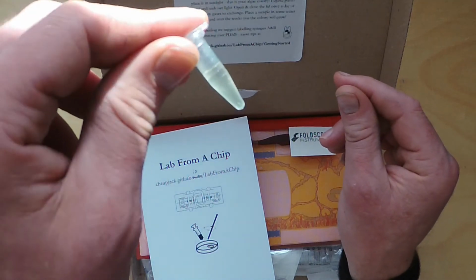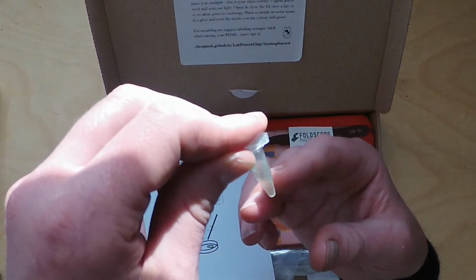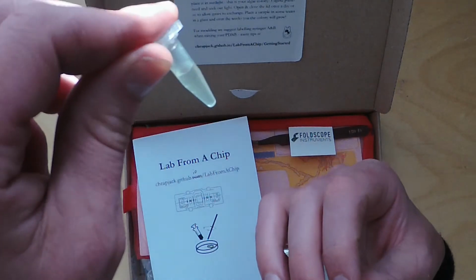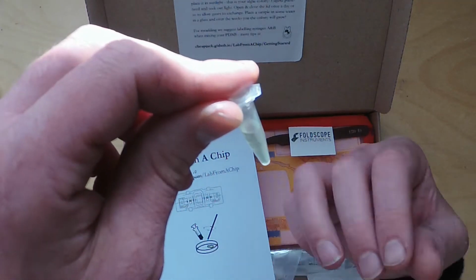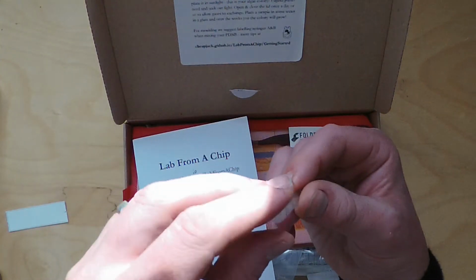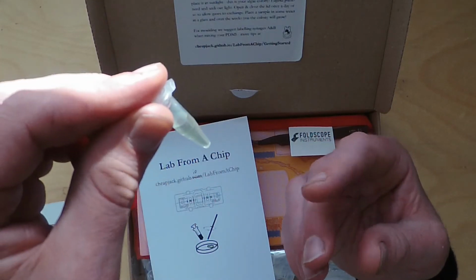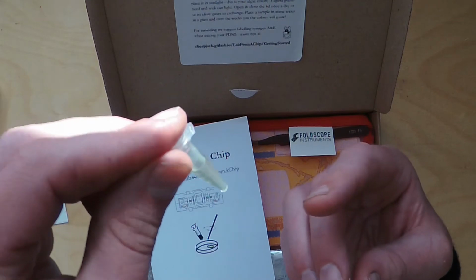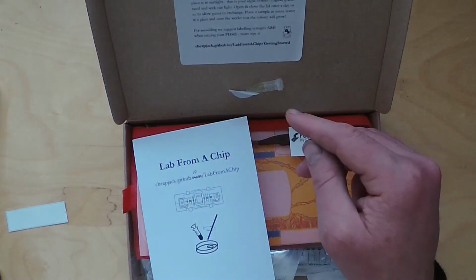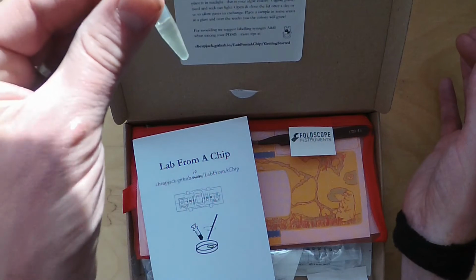This is a culture of the algae Euglena gracilis, which we'll talk about more in the actual session. If you hold it up to the light, you can see it's a green tinted liquid, so you want to be really careful of this. All the algae in here are alive, and they need to be kept in the sunlight to survive. So keep it propped up on a windowsill or something, or somewhere else safe.